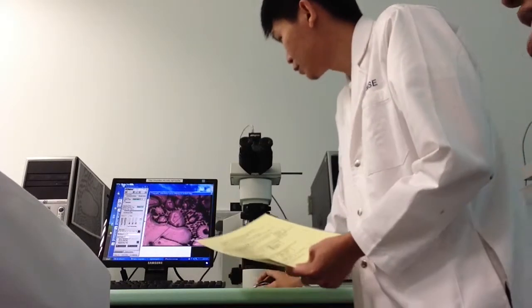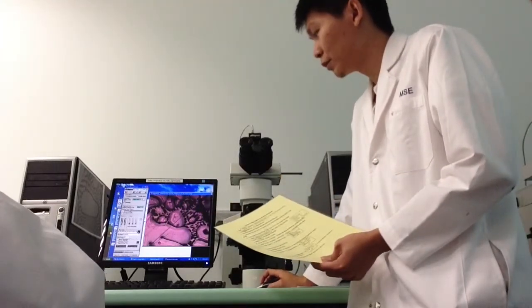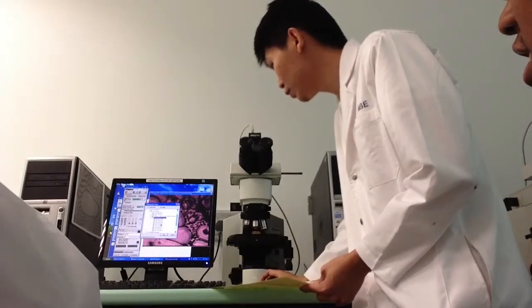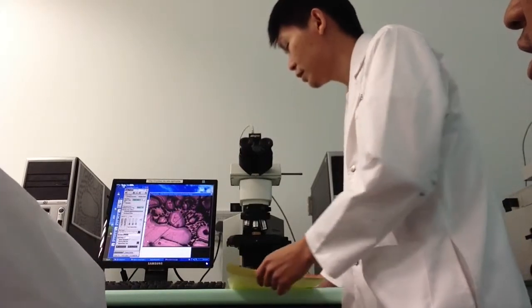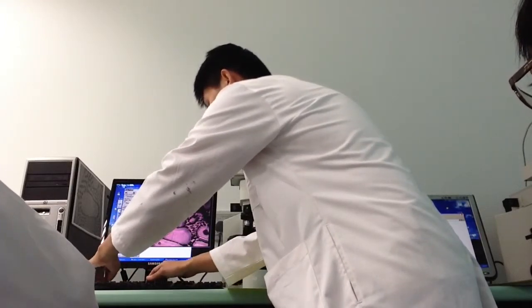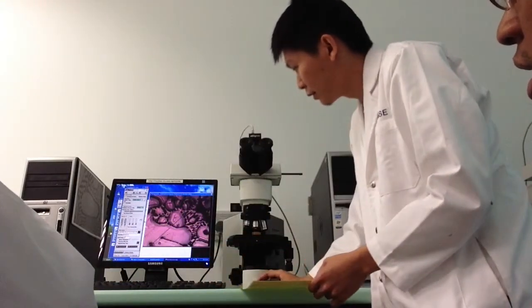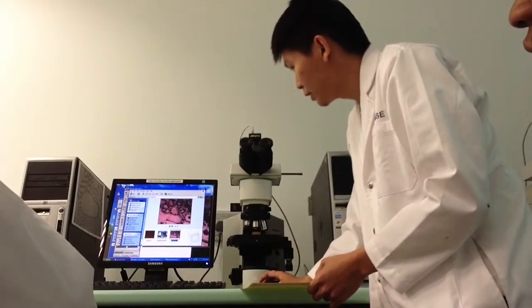Once you are happy with the image, same thing, you have to grab the frame first. So you specify your file path. Go to the same drive and folder. This one is Lab 2 and thin. This is 10 times. Same thing with grab frame. You just drag, and you should be able to see something like this.